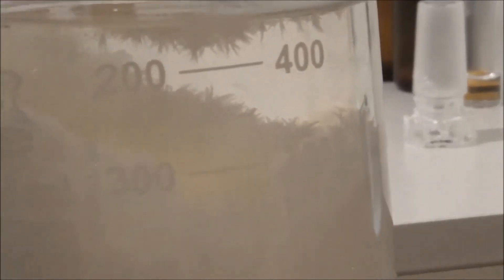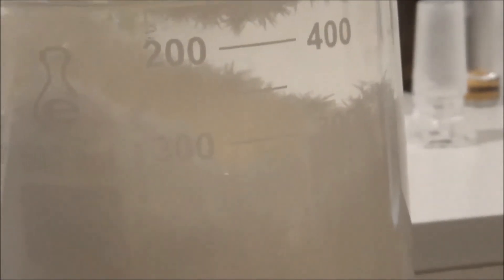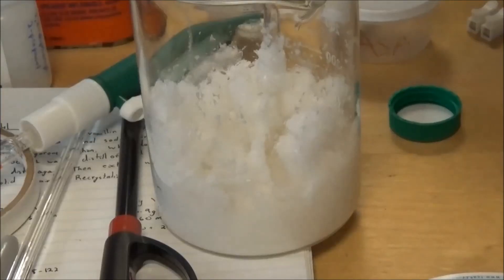Upon cooling to room temperature, over an hour and a half or so, you can see the very nice crystals which formed here. The liquid was poured off, and fresh distilled water was added. The crystals were mixed well with the water to wash them.